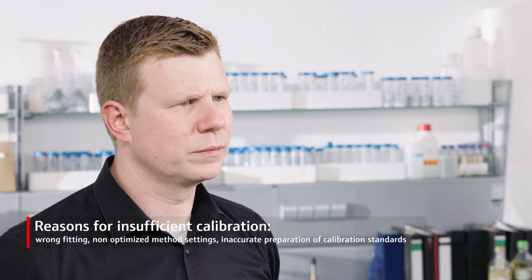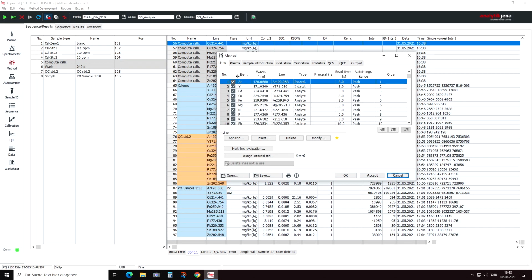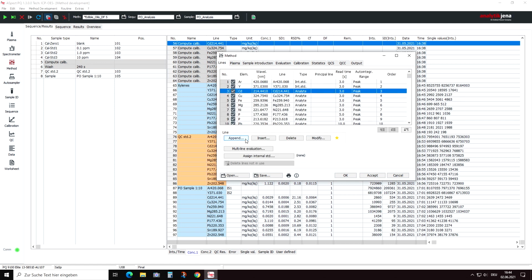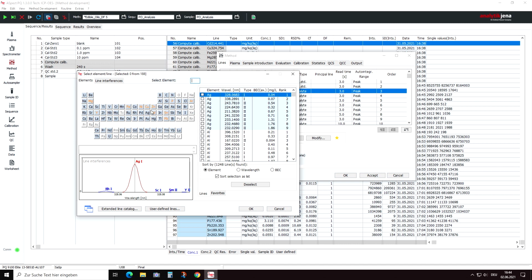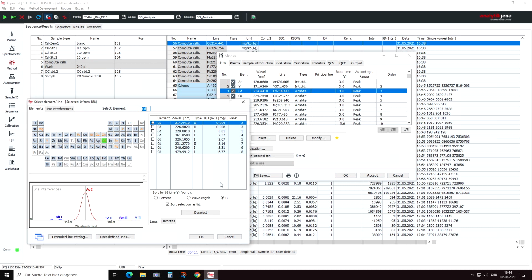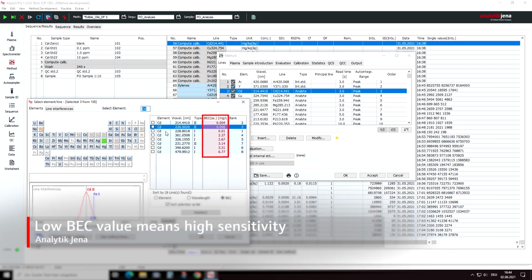calibration solutions. Regarding method settings, the correct choice of the plasma observation mode and the correct choice of the emission line is important, because the signal of the higher calibration standards may run into saturation and the sensitivity for the lower concentrated samples may not be sufficient for a precise calibration measurement.